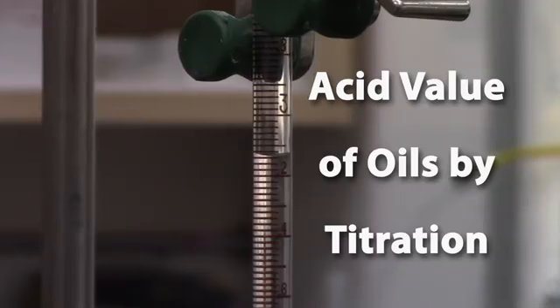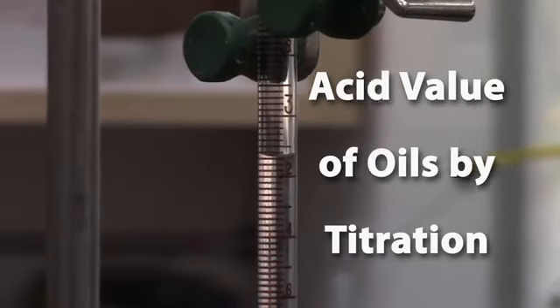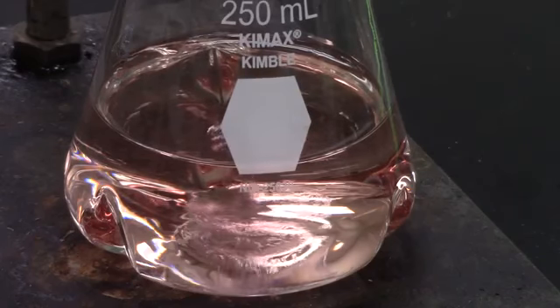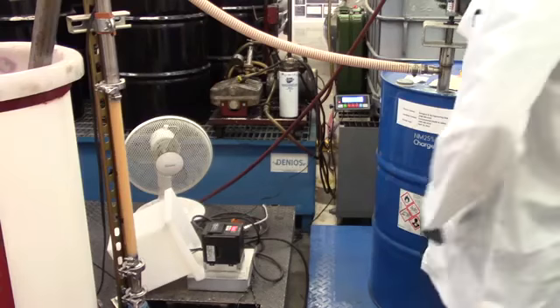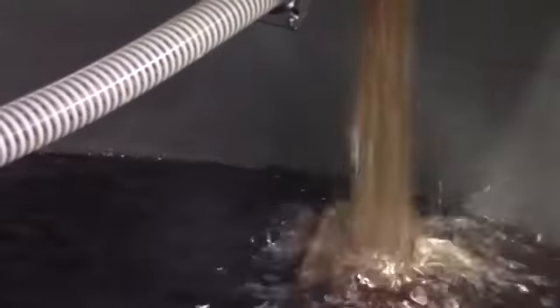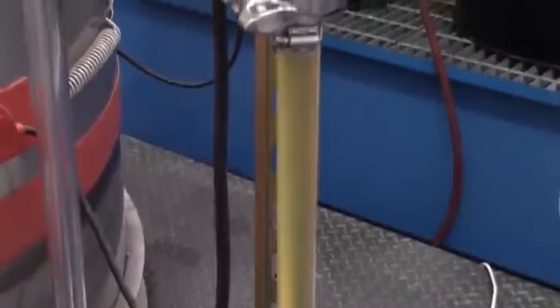Acid value of oils by titration for biodiesel. The acid value test is used twice in biodiesel production. The first time determines how much catalyst to use in the biodiesel recipe, subject to the properties of the oil. The second time determines how long the fuel's shelf life will be, subject to the amount of free fatty acids in the biodiesel.